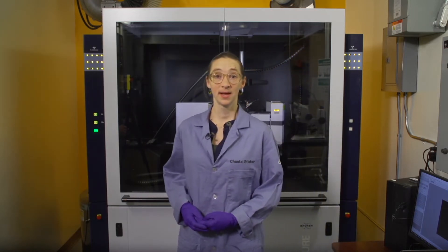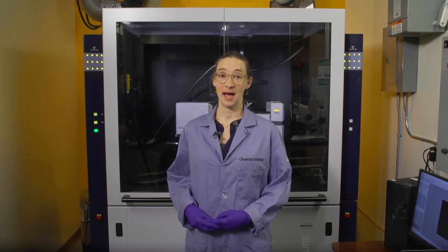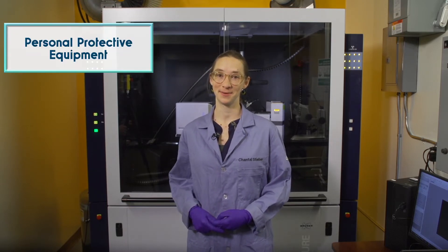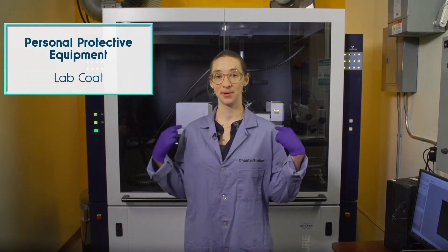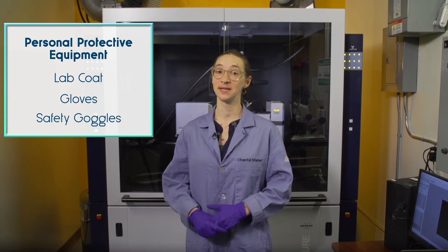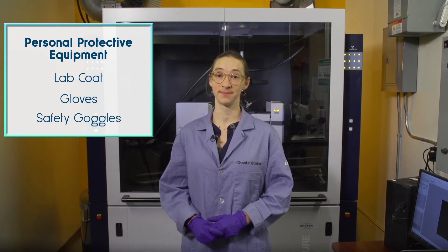Remember that to work safely in the lab, you will need appropriate personal protective equipment, including a lab coat, gloves, and safety goggles or safety glasses with side shields.